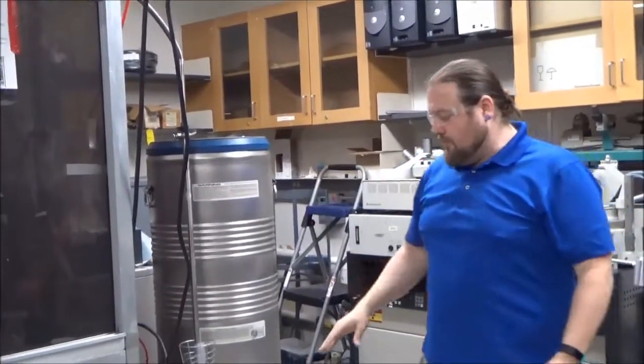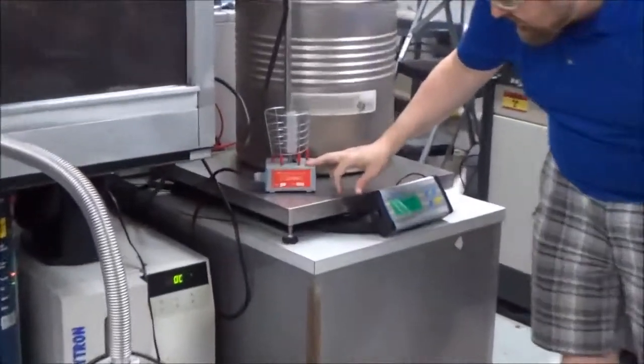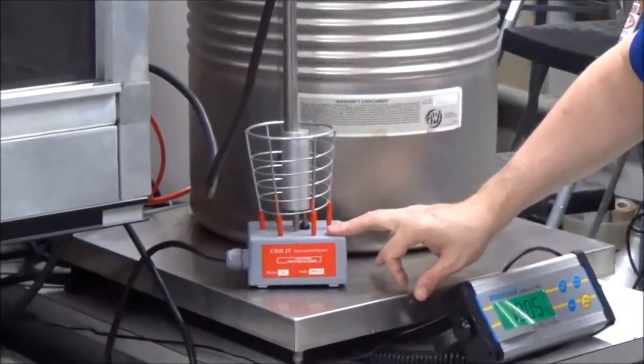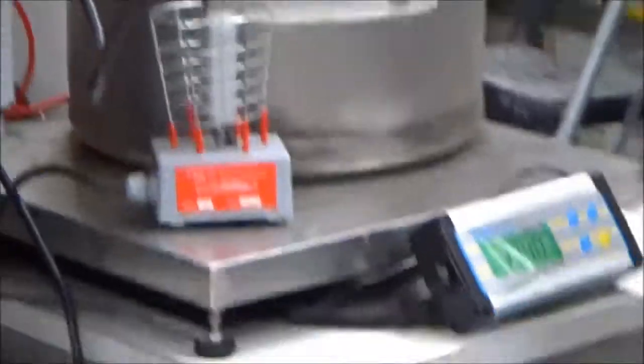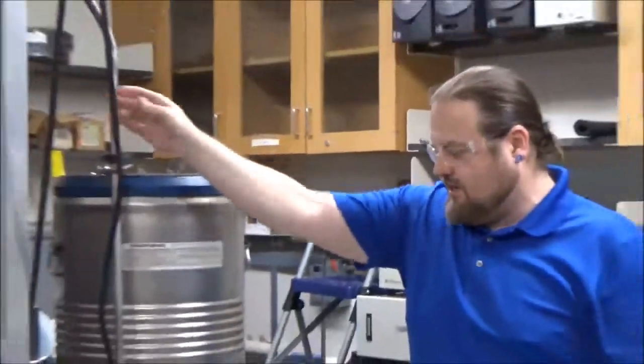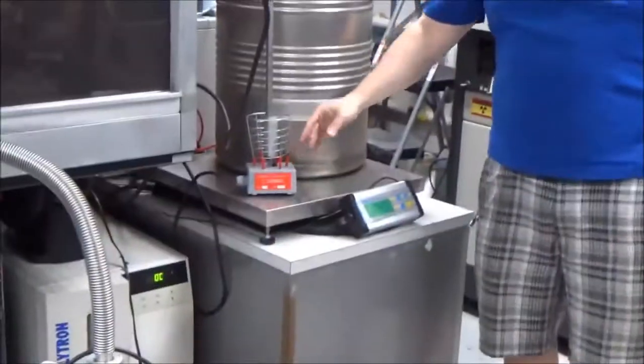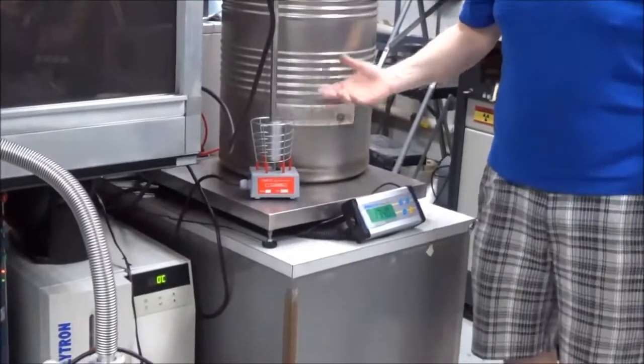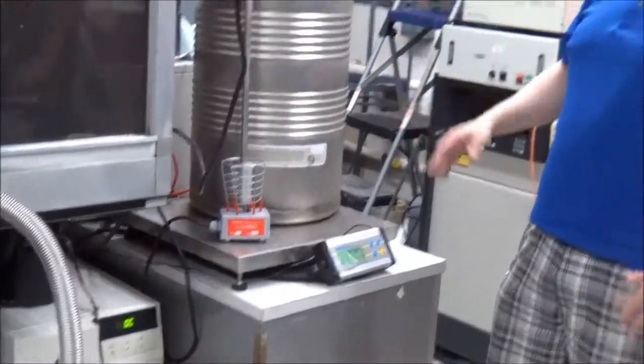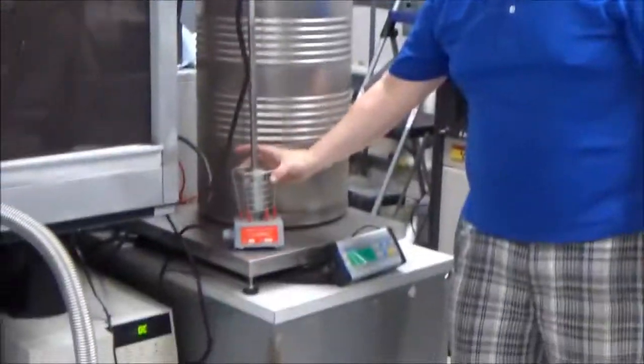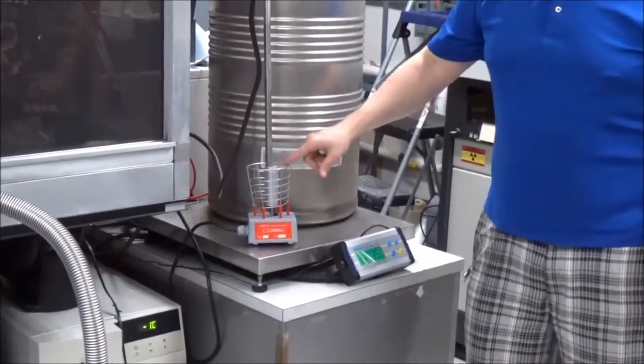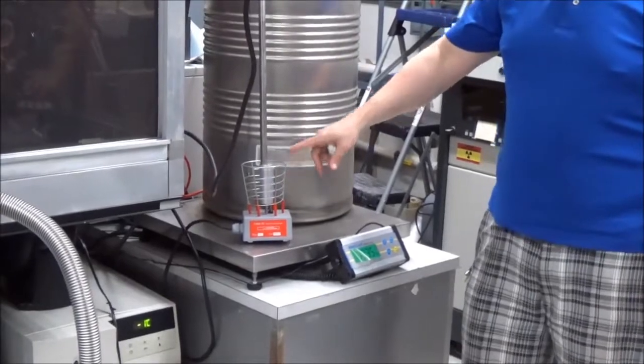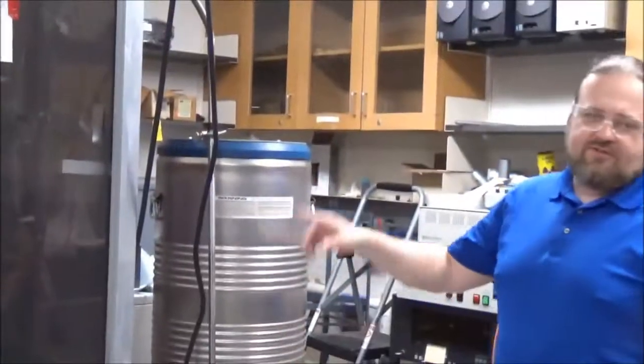Okay, the next step, what we do, there's a special device. This is the reactivation heater by Oxford. Basically, you just stick the transfer leg into here. This element heats up. It gets hot. I don't know how hot, but I don't want to touch it with my fingers. So it's important to be kept away from any flammable materials.